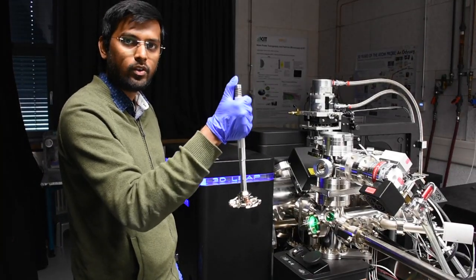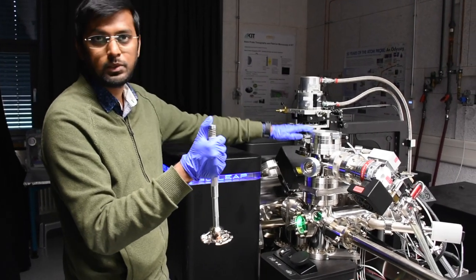So once we have loaded our sample onto the carousel, now we will move the carousel into our atom probe load lock.